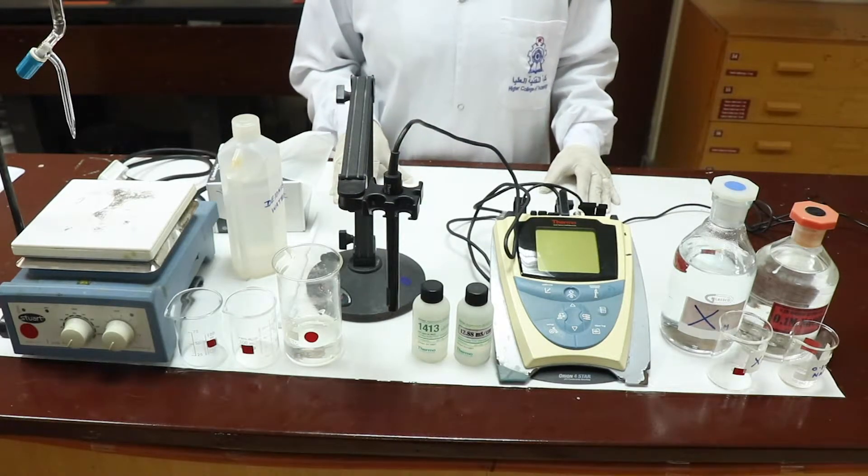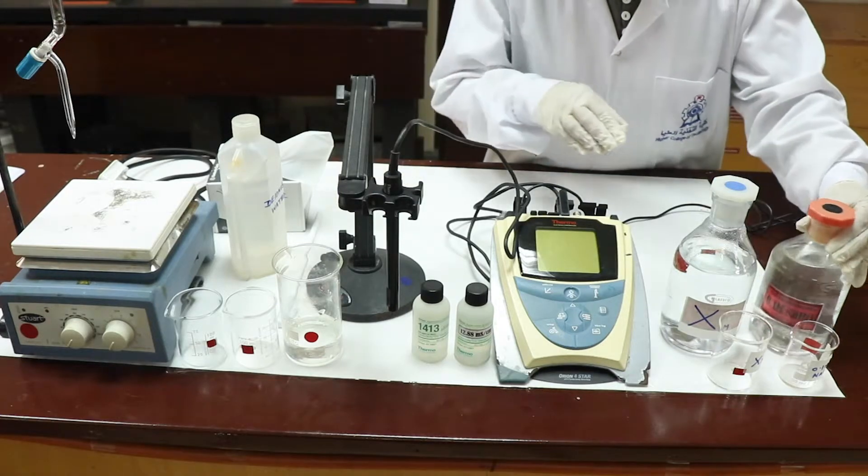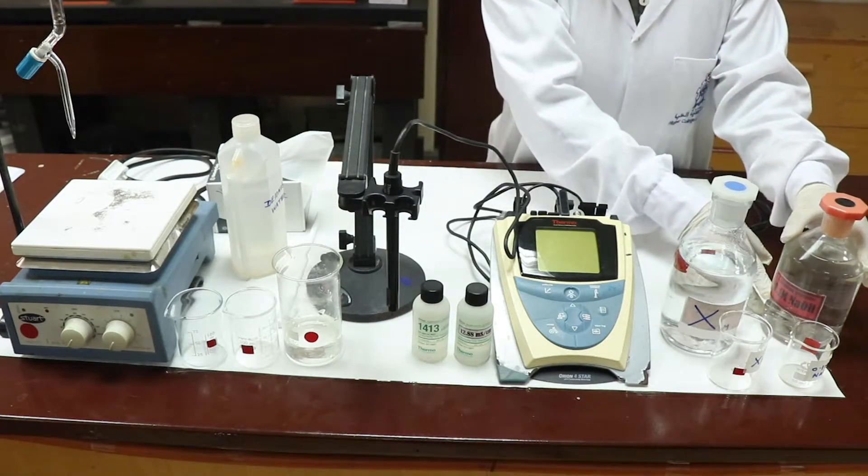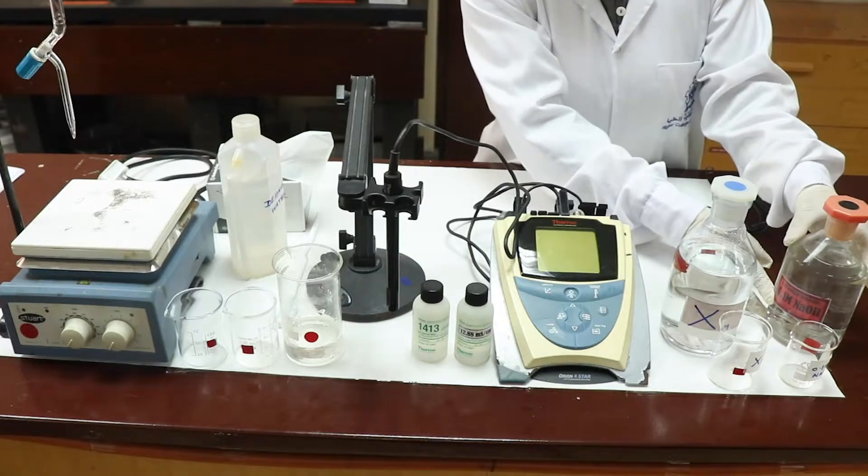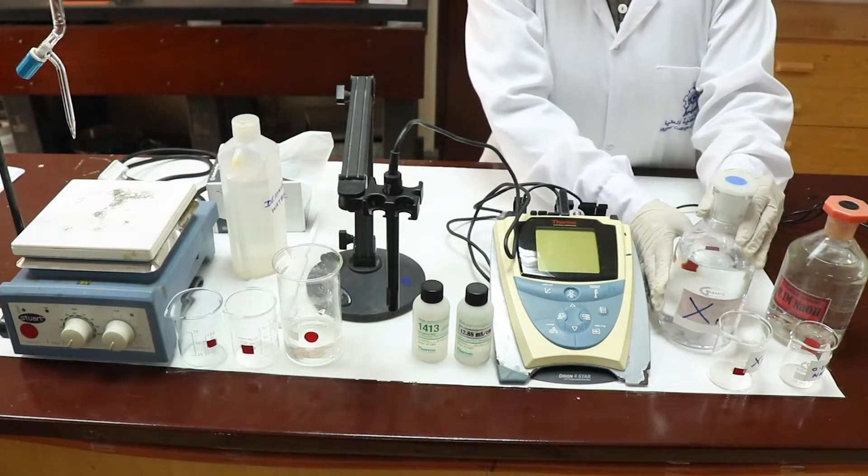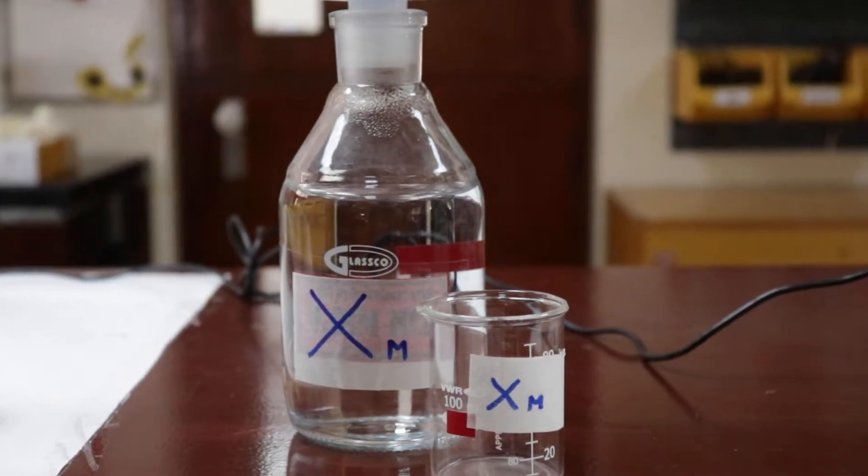Let us see the requirements. The requirements are a strong base whose concentration is 0.1 molar, a strong acid whose concentration we don't know.